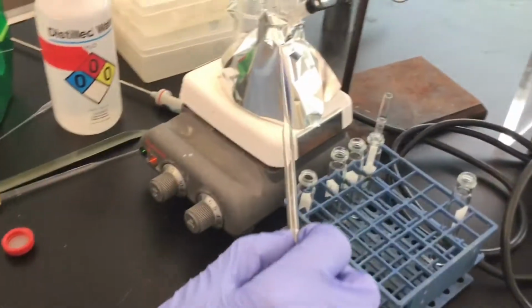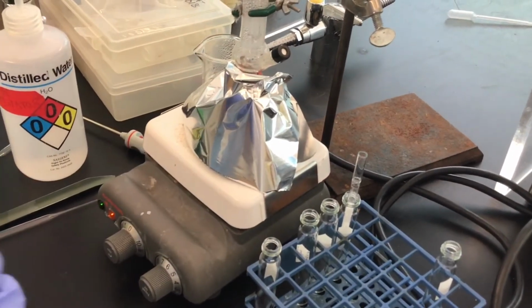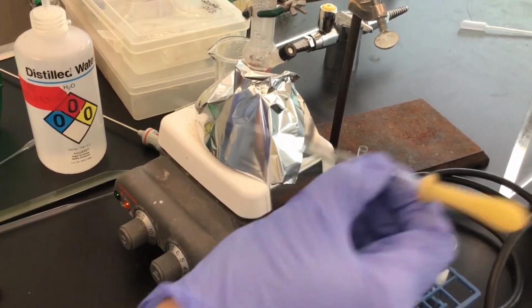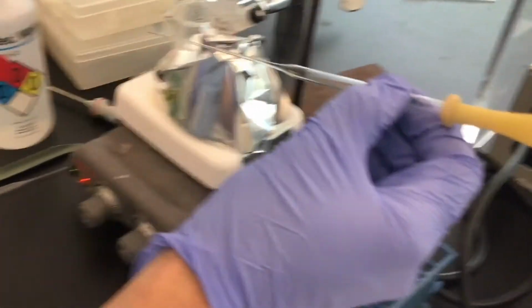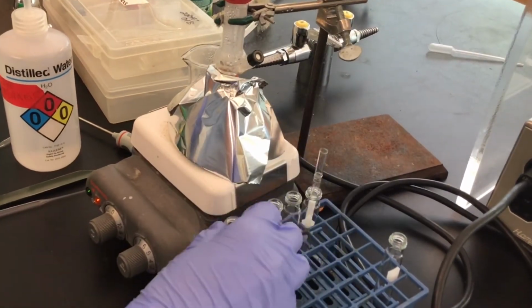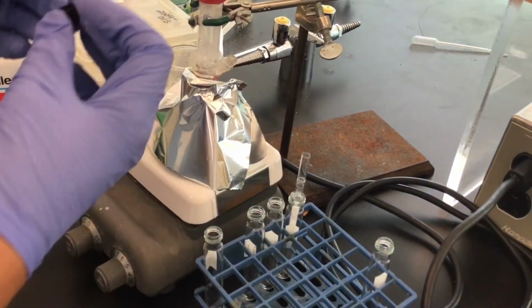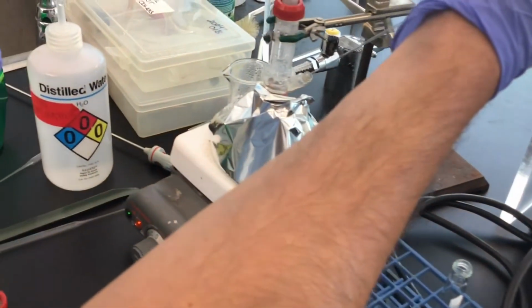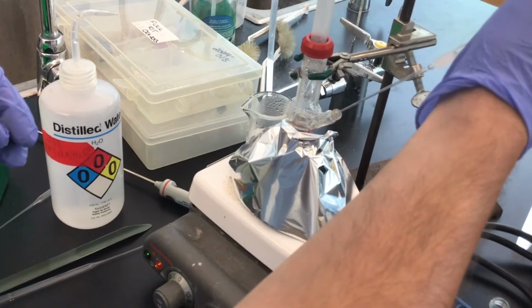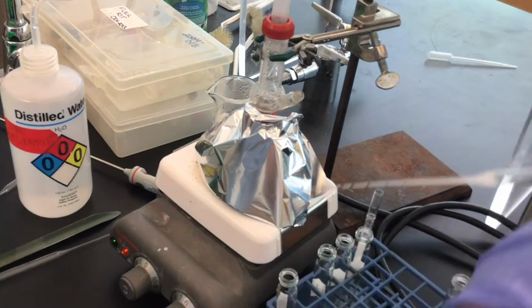All right, so we've got a good amount in the well of the still head that we can begin to collect our distillate. So I'm going to be sure to use the same Pasteur pipette every time I draw out the distillate. And so here once again is my culture tube marked to the 6 milliliters. And I'm going to unscrew this little cap, and I want to very quickly dive down with my Pasteur pipette and draw up the milky distillate. So if you look at my Pasteur pipette now, in there, that's the milky distillate that we're trying to collect.